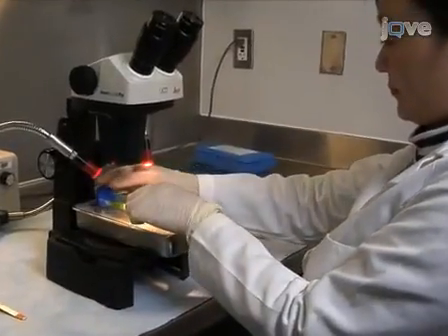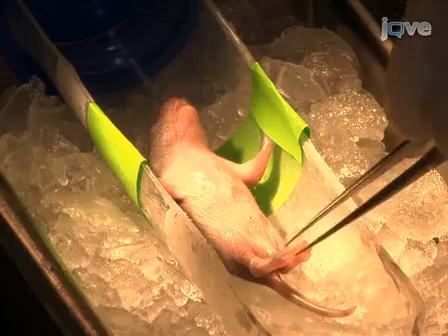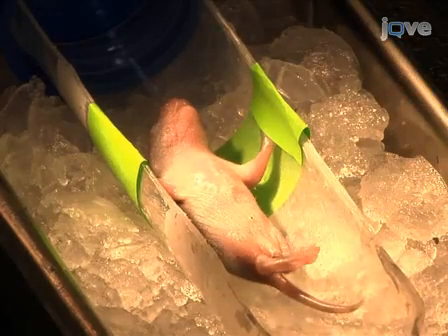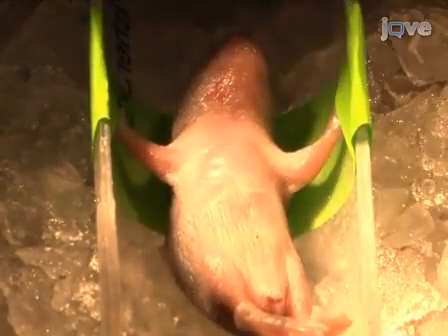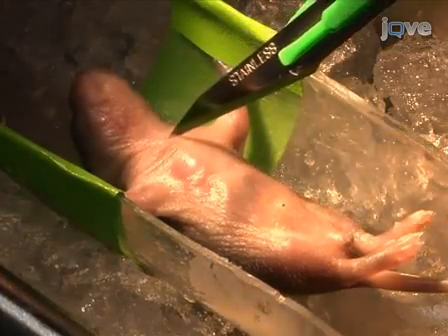Prior to the surgery for creating neonatal brain injury, perform a foot pinch to confirm that the animal is completely anesthetized. Clean the skin around the neck of the anesthetized P6 mouse with alcohol. Then make a midline ventral incision in the anterior neck. Under a dissecting microscope, gently retract the omohyoid and sternocleidomastoid muscles to access the right common carotid artery. Remove the fascia around the carotid sheath.